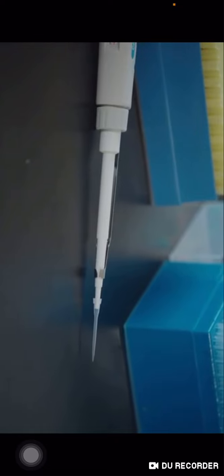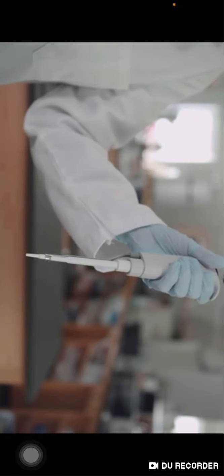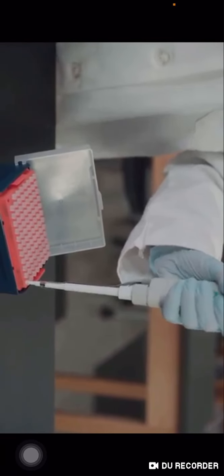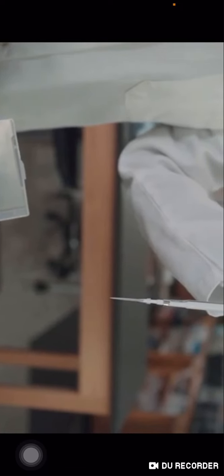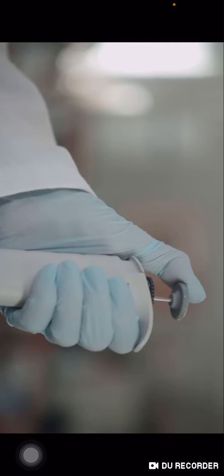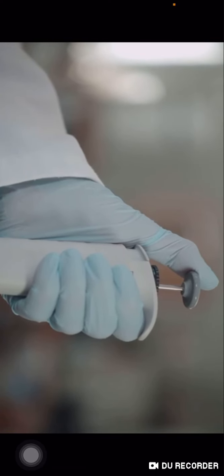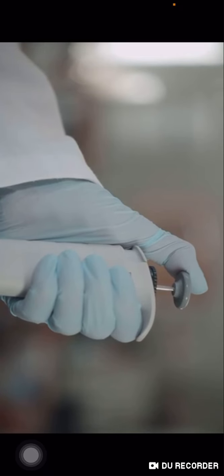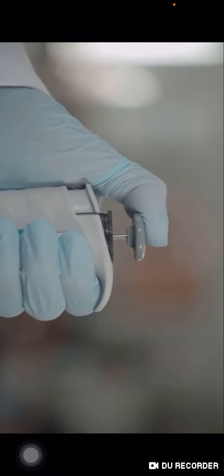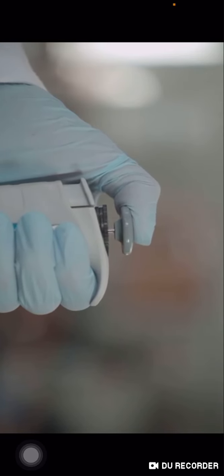In order to take up the indicated volume of fluid using the micropipette, we must first place a disposable plastic pipette tip onto the end of the pipette. Different types of pipette tips are used with different micropipettes. This clear tip is used with the P20 to take up the fluid into the pipette, as shown here inside the video. The fluid is taken up into the pipette tip by using the micropipette plunger.